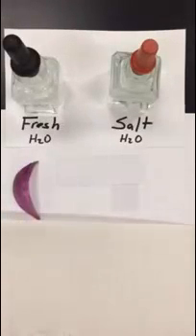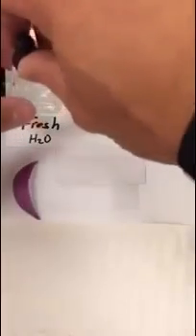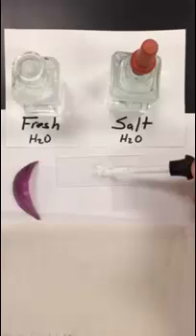So this is what we're going to do. The first step in setting up a wet mount slide for viewing under a microscope is this. You're going to take your fresh water and you're going to add about two to three drops to your microscope slide. This will give the area for the specimen to sit in.